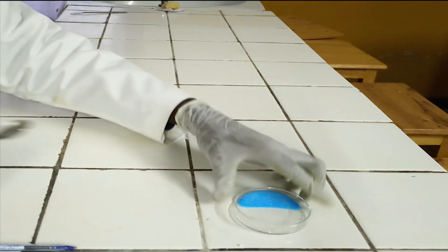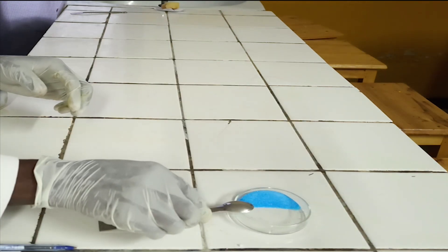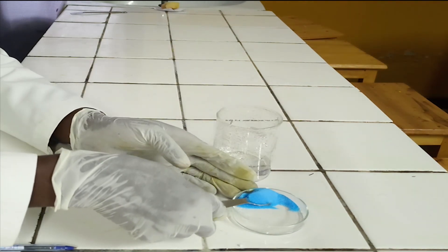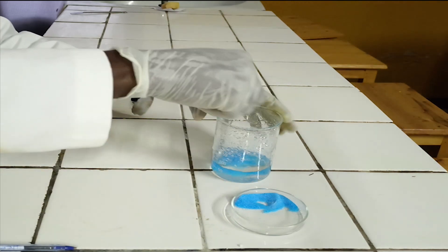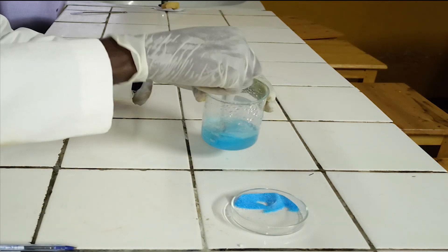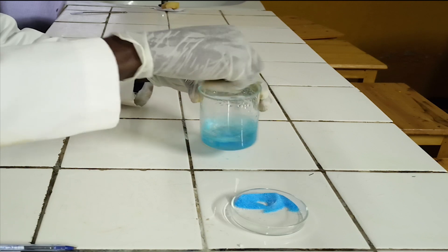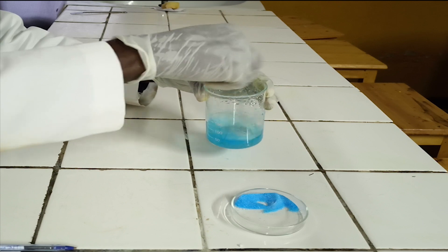Test for copper-2-ion. The first step is observation. The color of this copper-2-ion salt is blue. Dissolve a spatula of salt in 50 milliliters of water. When salts of copper-2-ion dissolve in water, they form a blue solution.